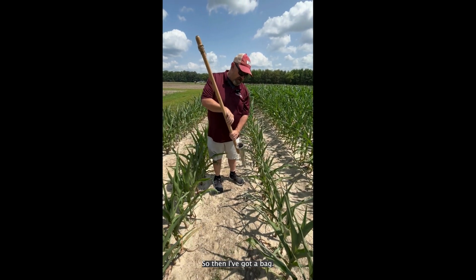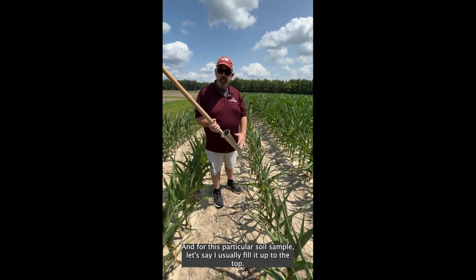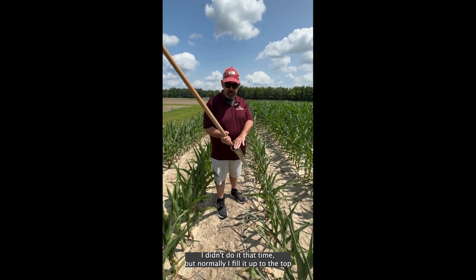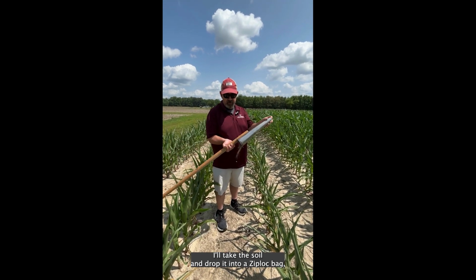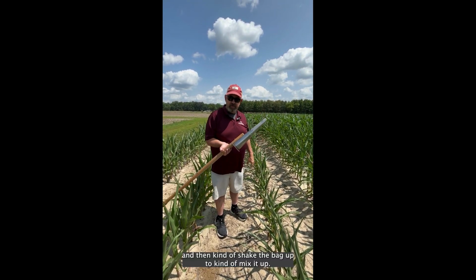So then I've got a bag. I usually have a Ziploc bag with me. And for this particular soil sample, I usually fill it up to the top. I didn't do it that time, but normally I fill it up to the top. I'll take the soil and drop it into a Ziploc bag, and then kind of shake the bag up to mix it up.